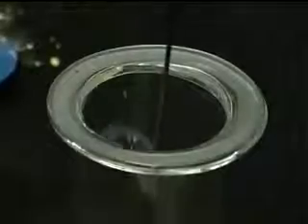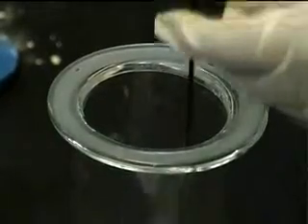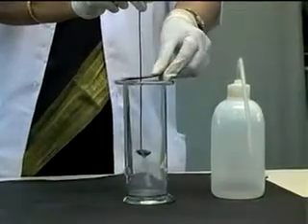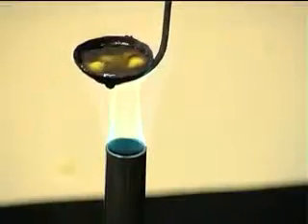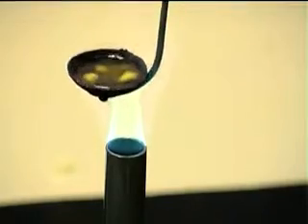The jar is closed with the lid to trap the gases inside. When sulfur is heated, it melts and eventually burns in oxygen with a blue flame.